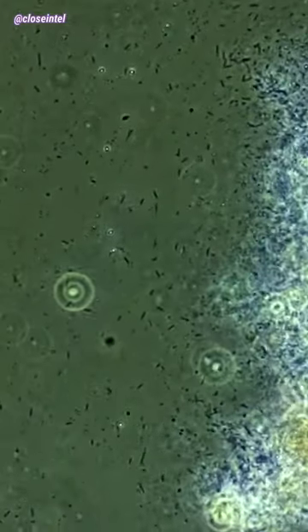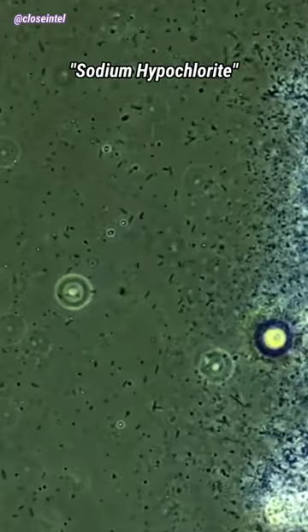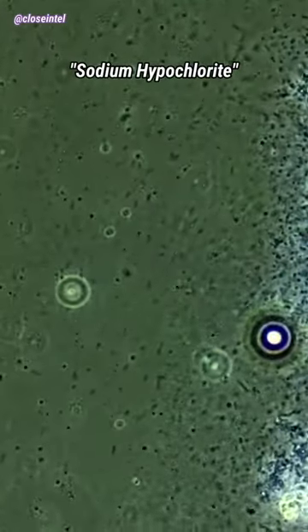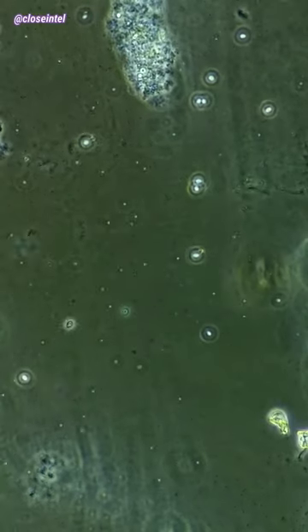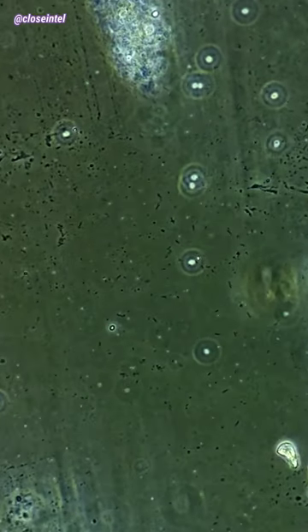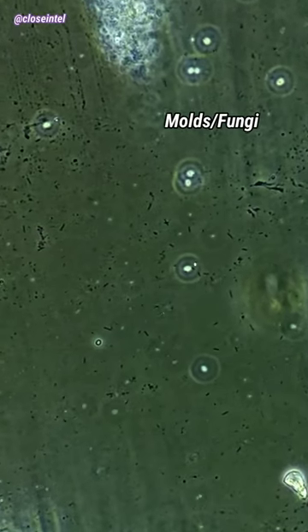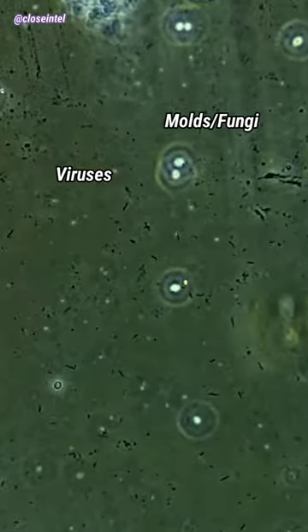Bleach is actually a base with an active ingredient called sodium hypochlorite, and it attacks proteins in bacteria, which causes their cell walls to rupture. You can also kill molds, fungi, and even viruses with bleach.